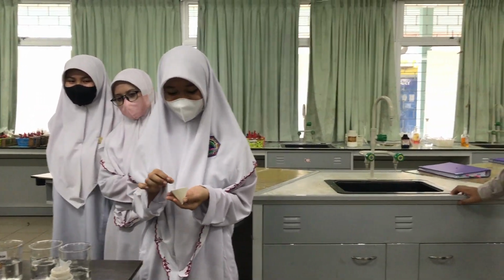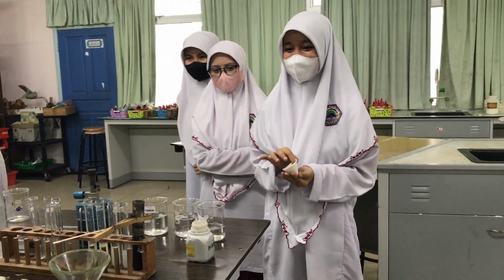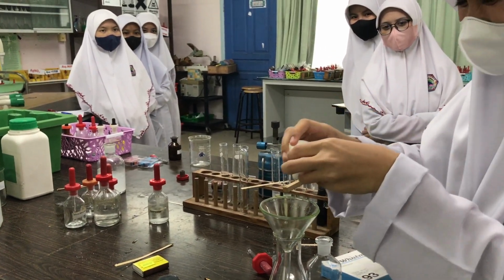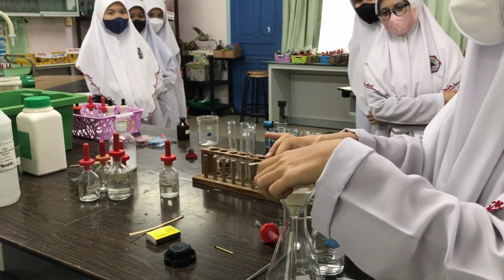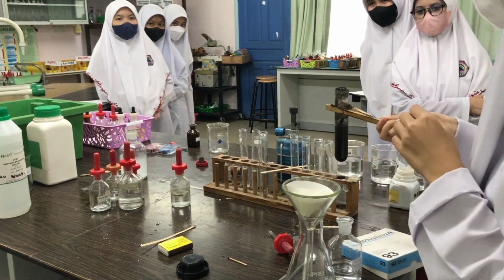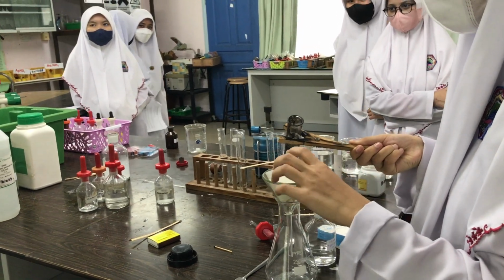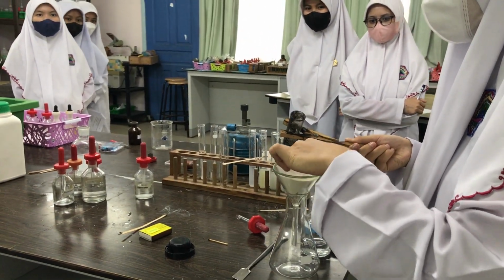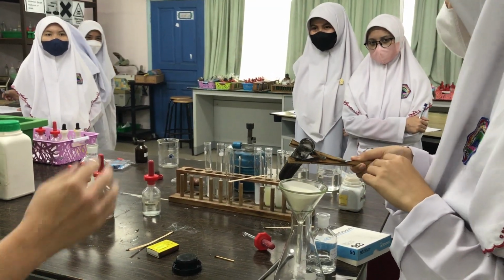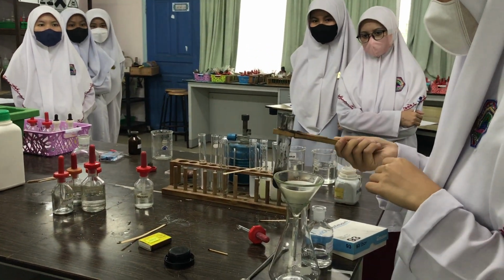No, look. And then, now put. What next? Oh. So, where is the black solid going to remain? Filter paper. Okay. What is the solid on the filter paper called? I know it's precipitate. I know it's the solid. What do you call it? A special name given for it? The solid that is left behind. Residue, because it's the English word. Okay, enough. The English word is residue.